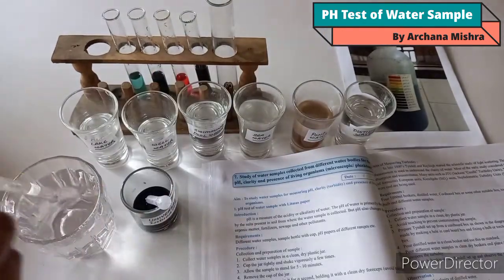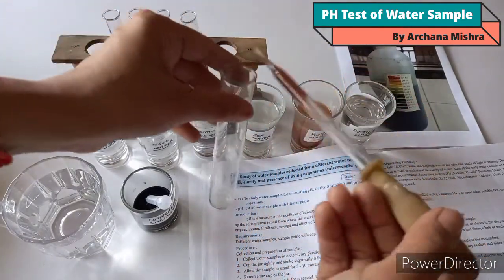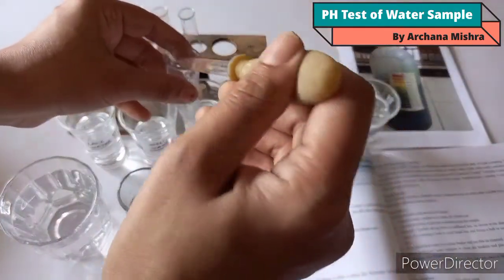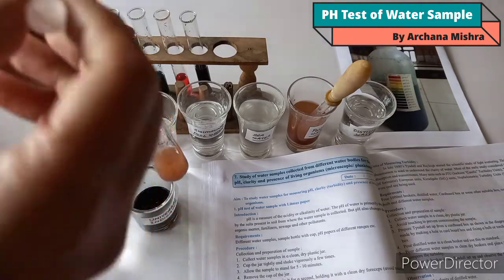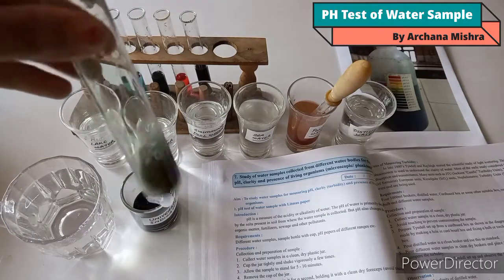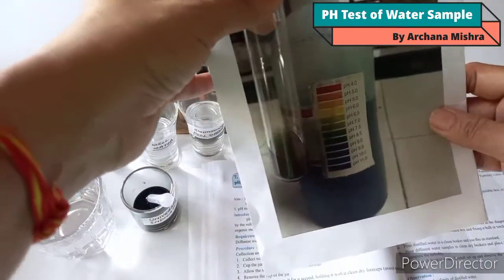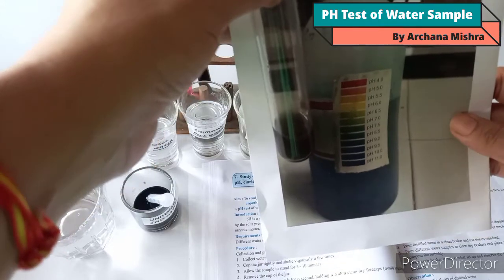For the next water sample, clean the dropper and take pond water in the test tube. Add a few drops of universal indicator and observe the color change. Match it with the pH color chart. The pH of pond water is 8.5. Record your observation — pH of pond water is 8.5.